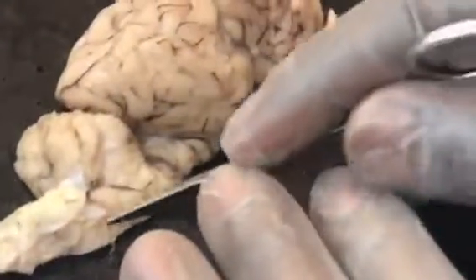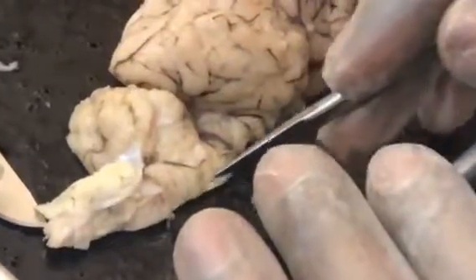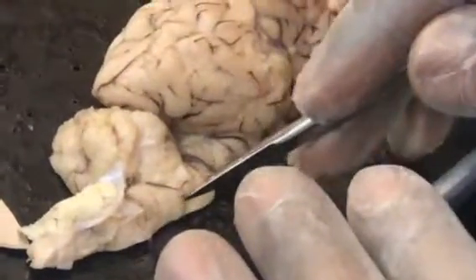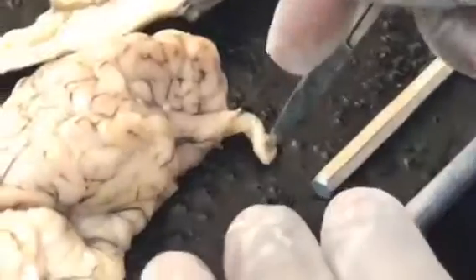And this looks real chopped up, but here's your spinal cord. This should be around your medulla oblongata here. The olfactory... actually, there it is. You have a very good olfactory. So this here is your olfactory.